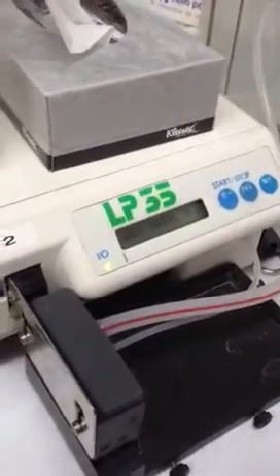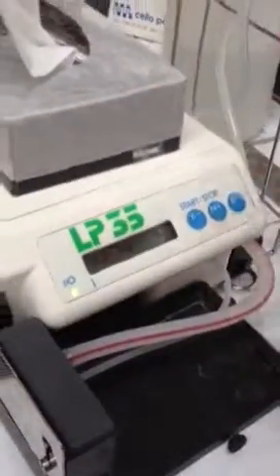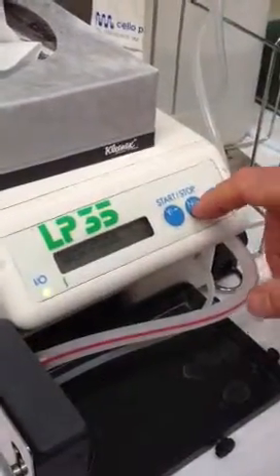If you don't like them, then we can fill them. There are a set of instructions somewhere. So if you're happy with what we use, then just use what we use — whatever's in there. At the moment I'm just going to keep going.